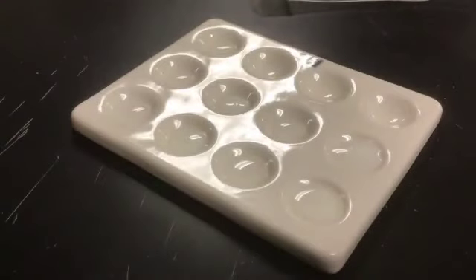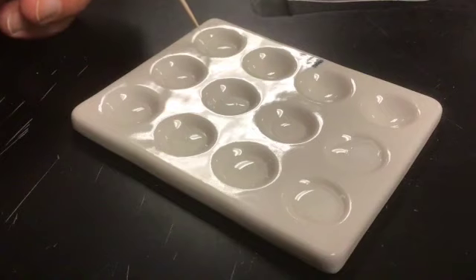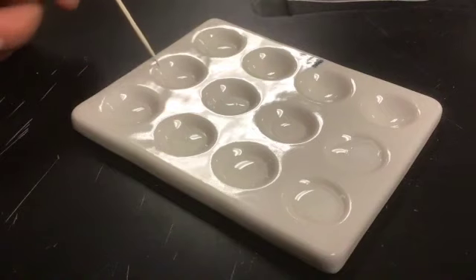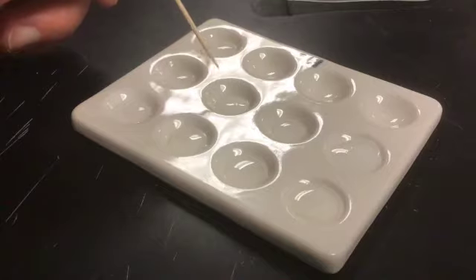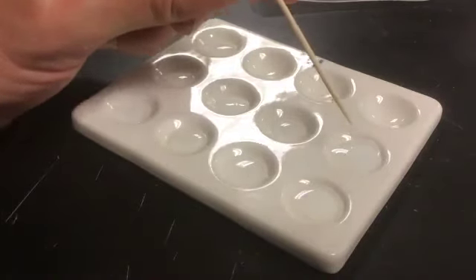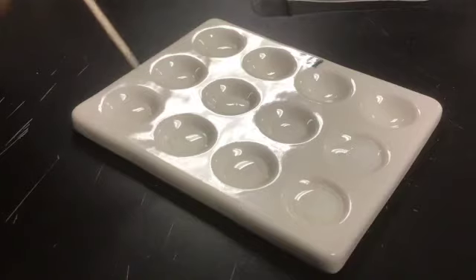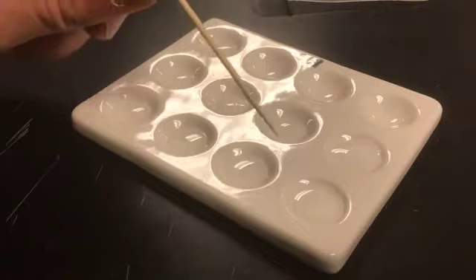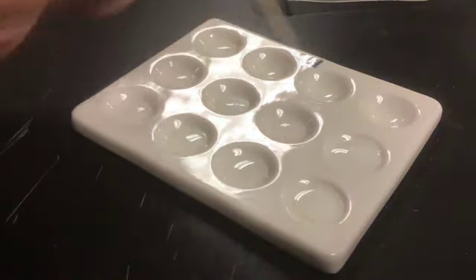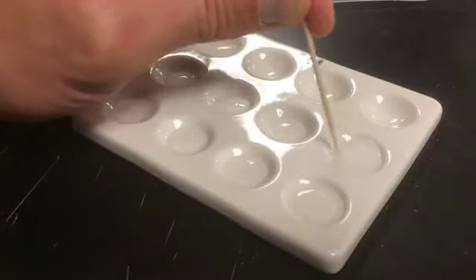So I have set up my wells. This is my water, and that is for a control. And then I have a well of glucose. Here I have milk. Here I have Lactaid, and here I have milk plus Lactaid. Down here I've added acid to each one. So here it's Lactaid and acid, and then here it's milk and acid, glucose and acid, and then milk, Lactaid, and acid.